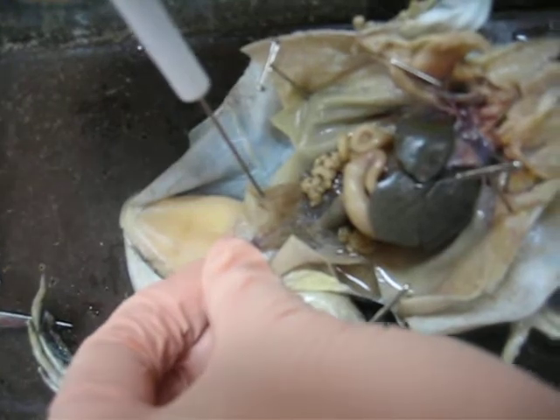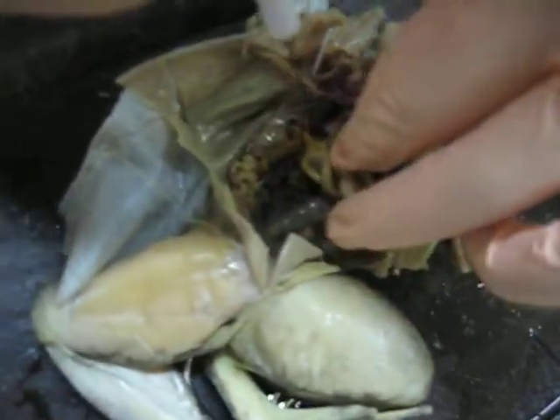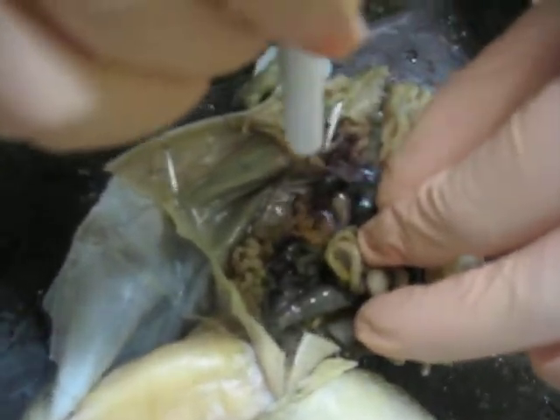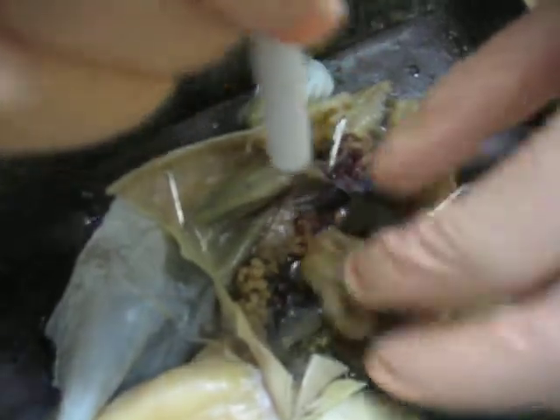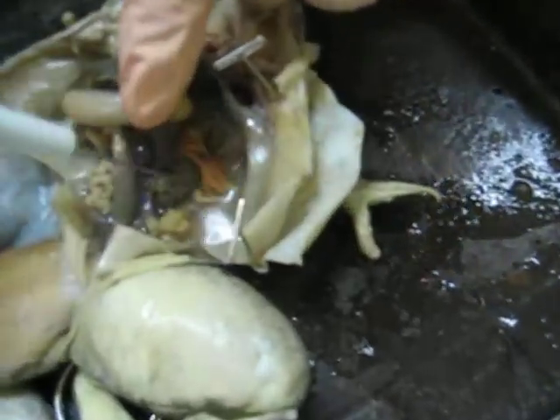Spleen — my spleen is this one. Fat bodies. Fat bodies — little yellow spaghettis over here and we have some over here.